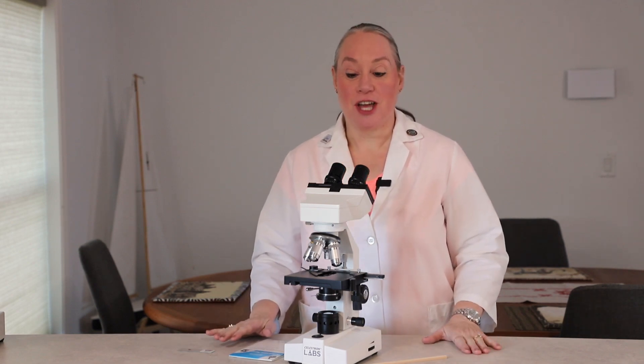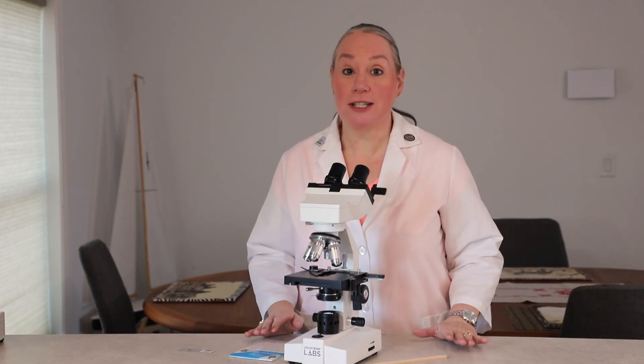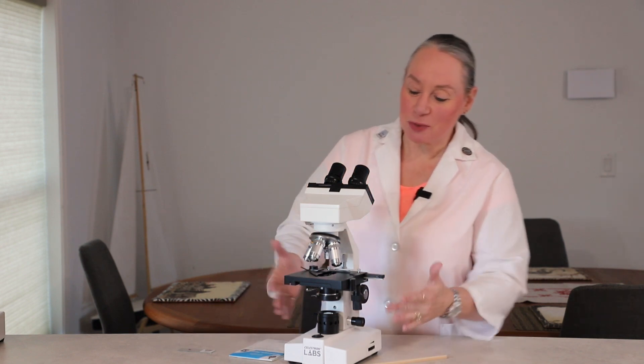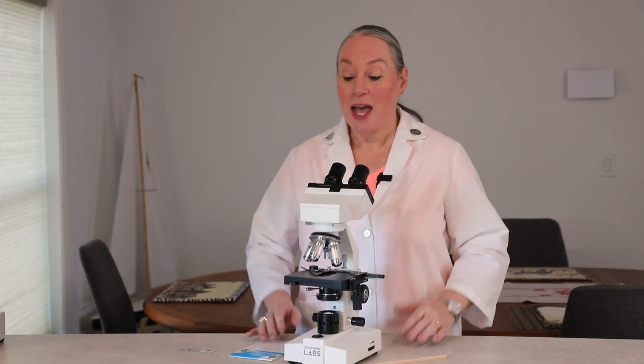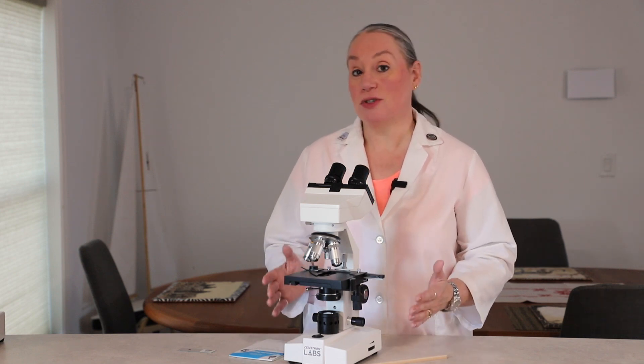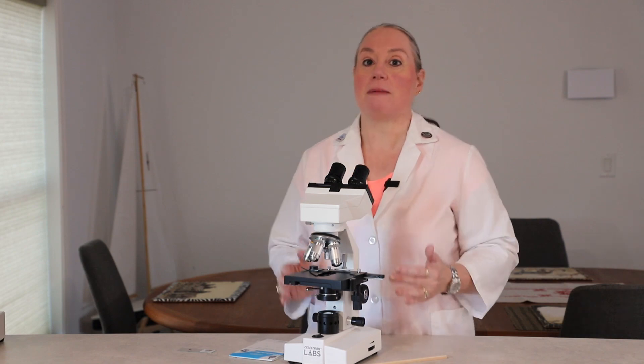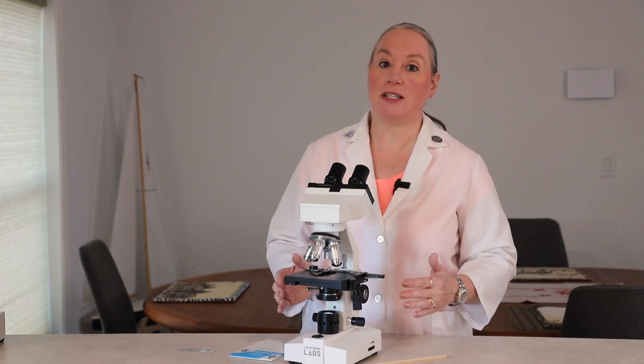It's time for another adventure. This is called microscopy. What is that big word? It just means we're going to use a microscope and we are going to look at things that we cannot see with our natural eye. I am very excited to introduce this to you. Some of you may have already used microscopes, and some of you for the very first time are going to get to use them.